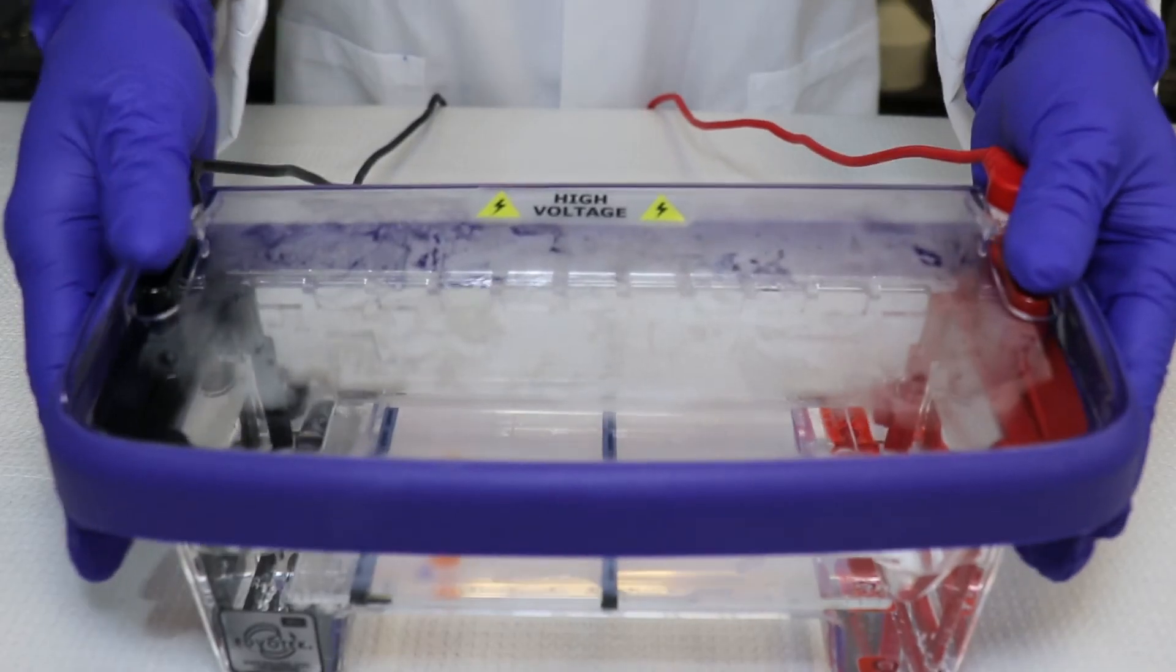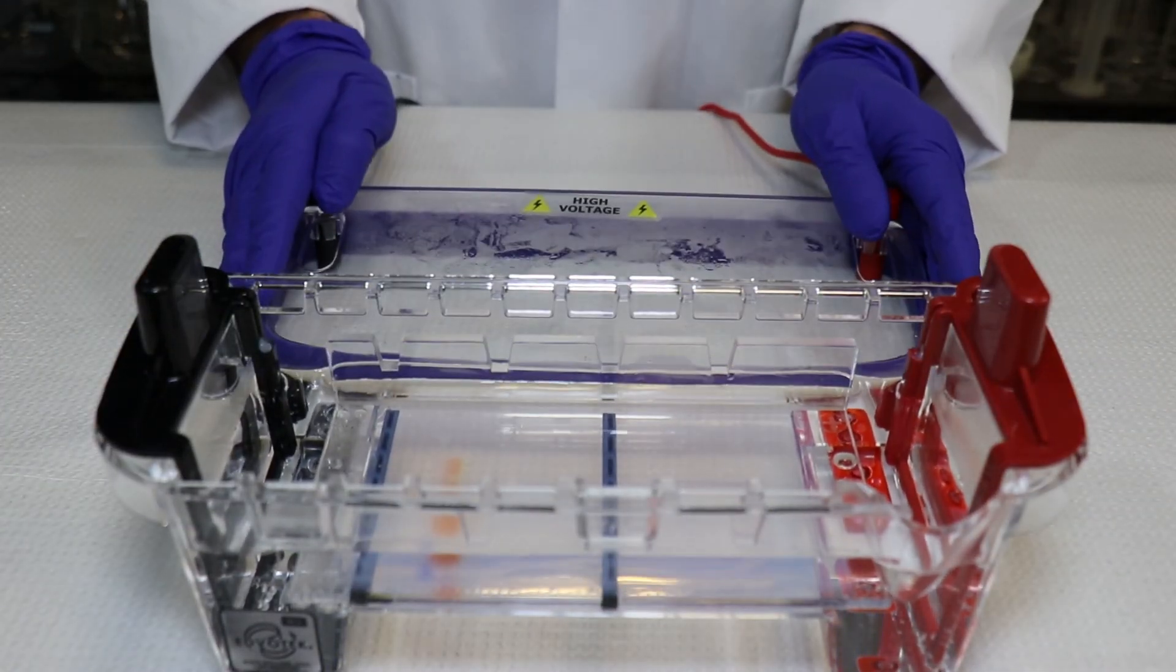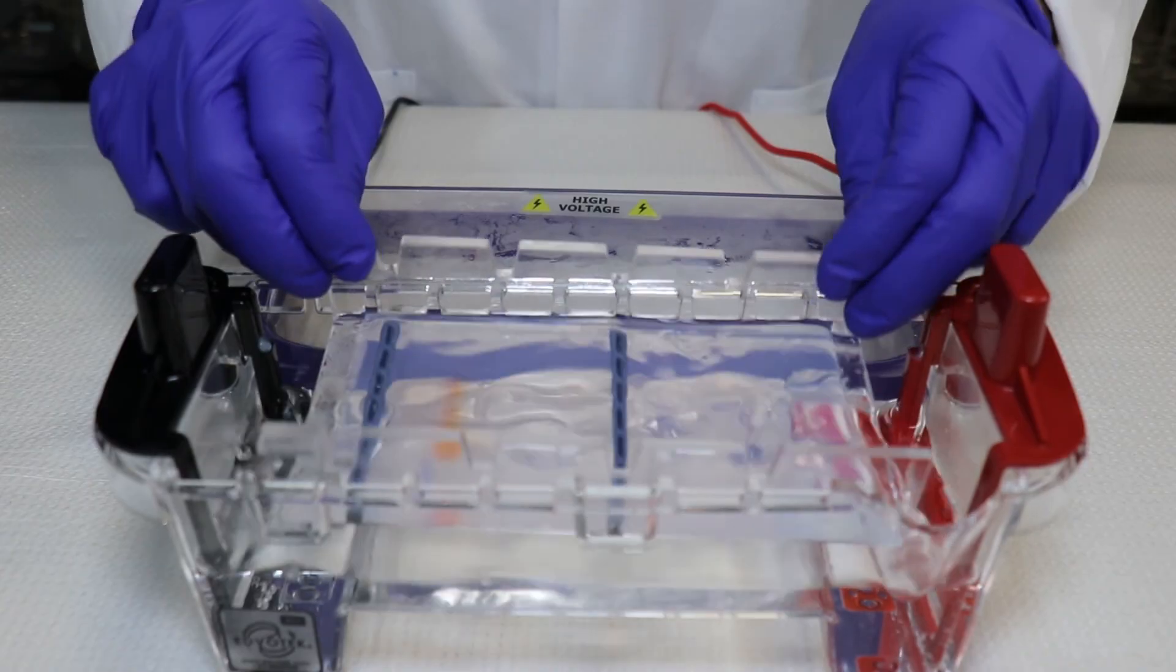Step 12: After electrophoresis is complete, remove the gel and casting tray from the electrophoresis chamber.